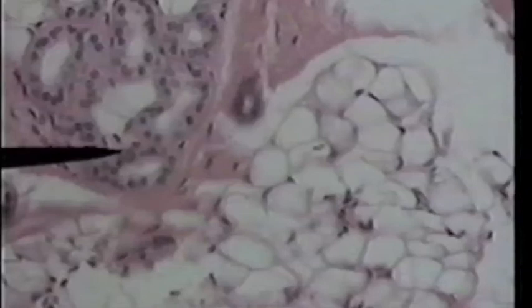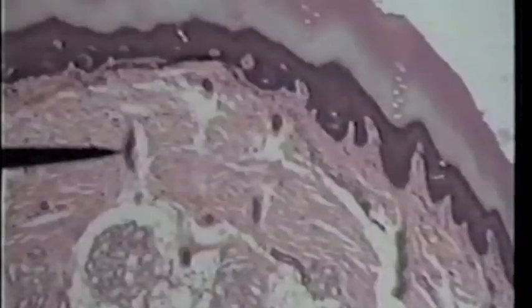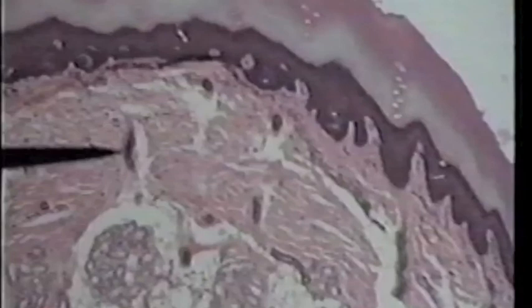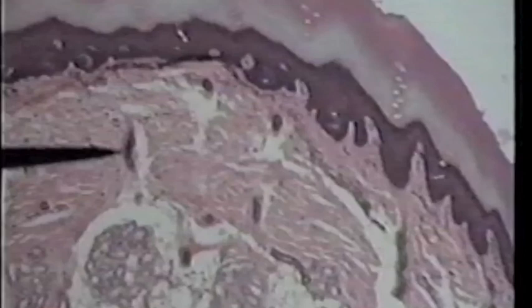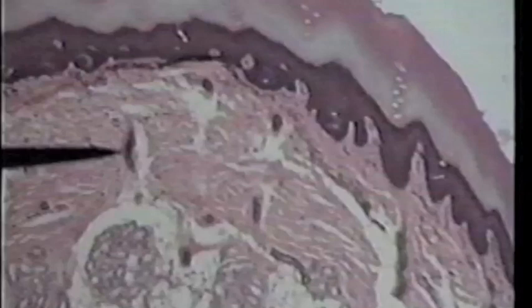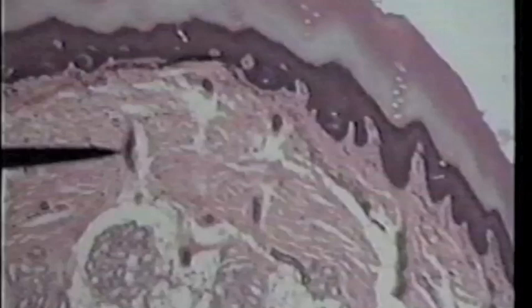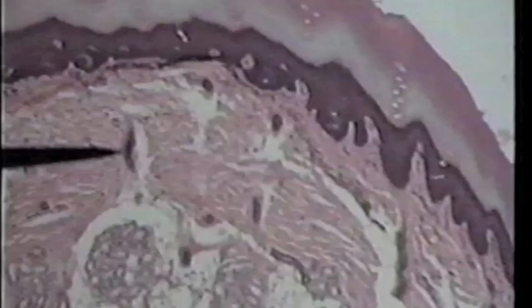We'll now move to a slide that shows a duct. We're back on low power looking at the dermis. Inferior to the pointer you can see a sudoriferous gland. The tip of the pointer is actually on a cut through the tubule that we call a duct, which carries the secretions from the sudoriferous gland to the surface. So this would be a sudoriferous gland duct.